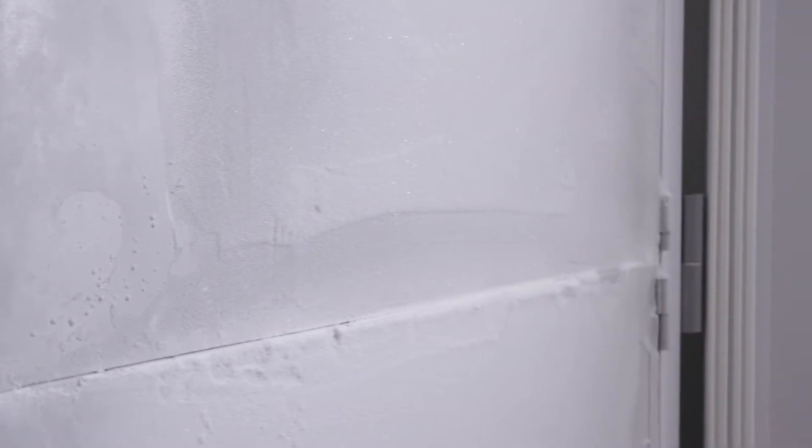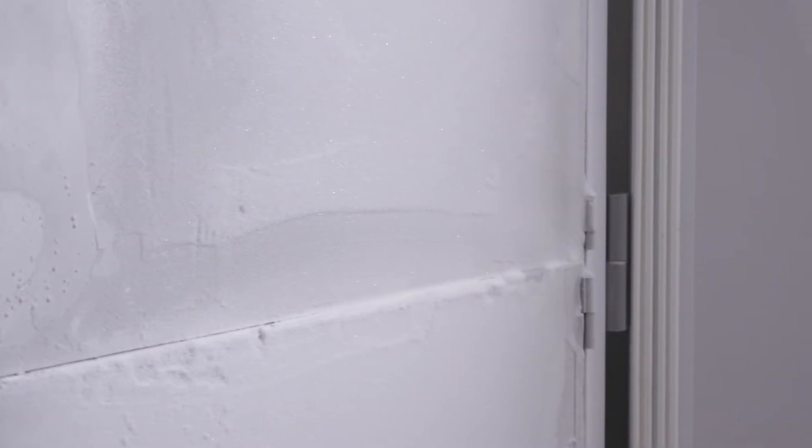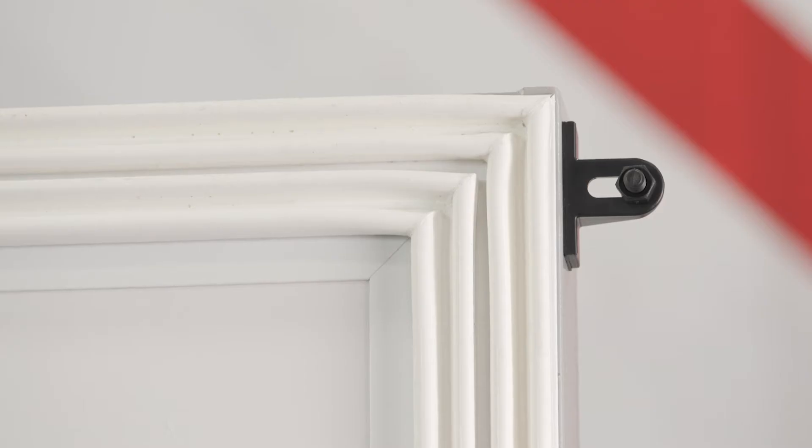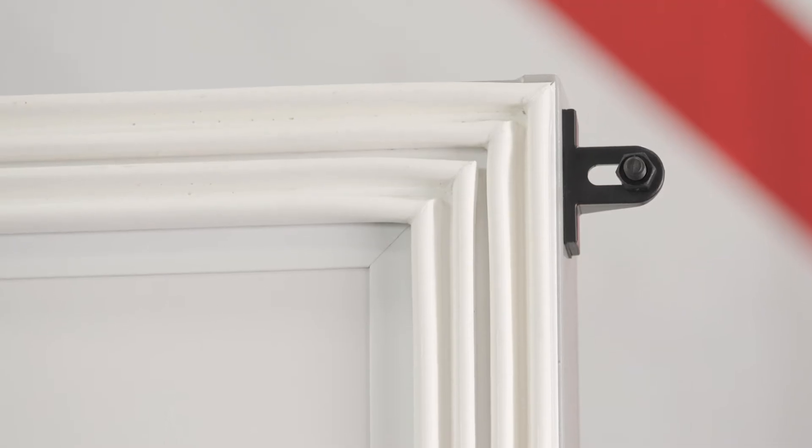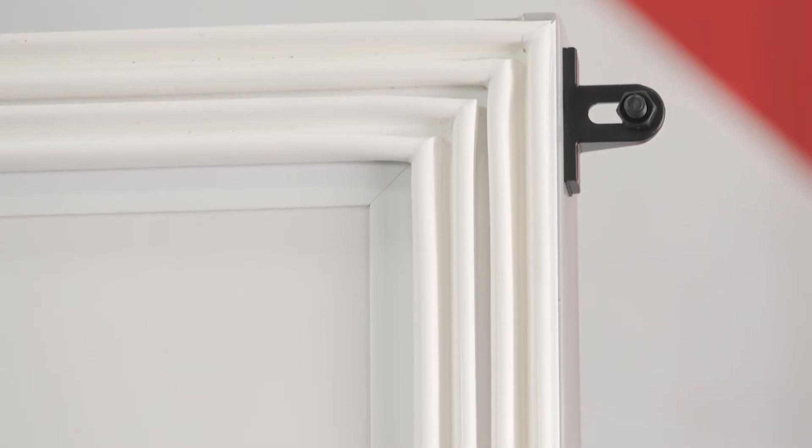Let's start with something you should do periodically. As warm ambient air hits cold surfaces within and around your freezer, condensation and eventually ice or frost can form. When this builds up around gasket surfaces, it can affect the seal of the door and allow continuous warm air into the cabinet. This ultimately leads to more and more frost buildup. It's a vicious cycle.